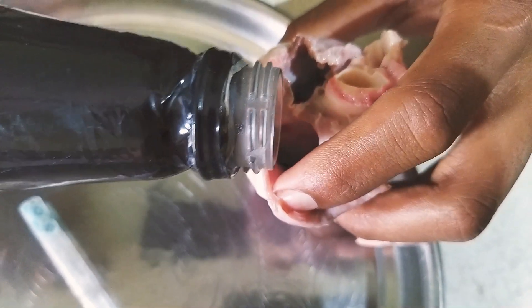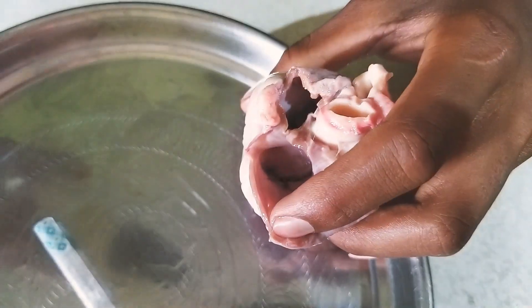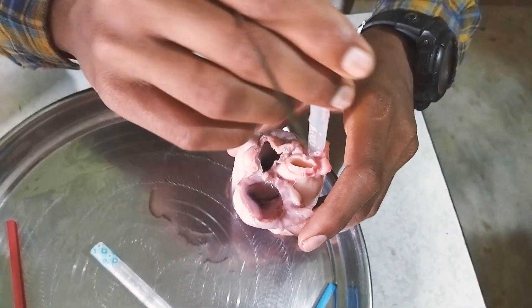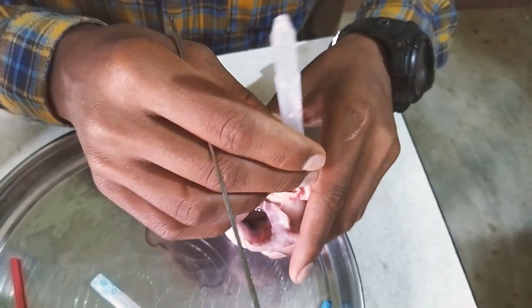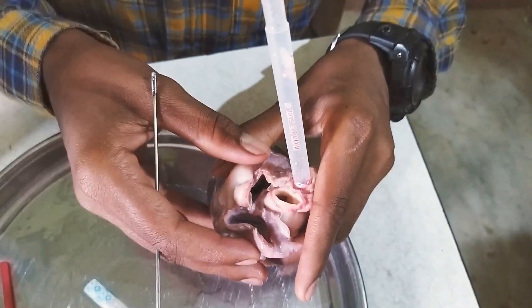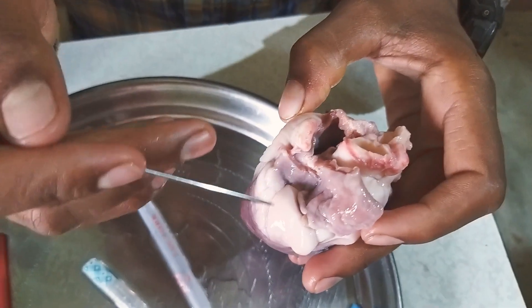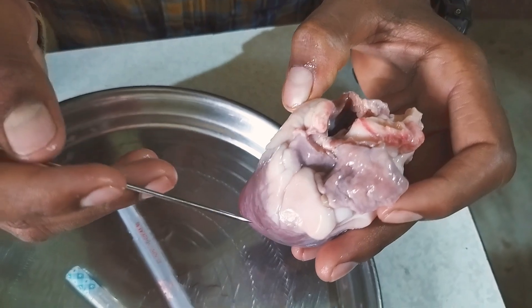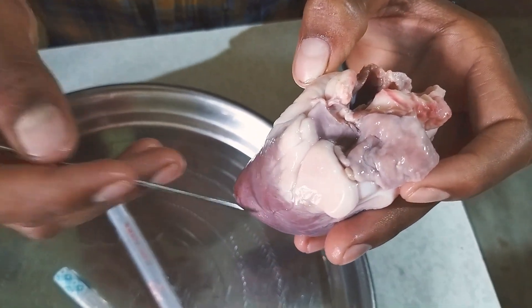I am filling some water in the pulmonary vein. Observe carefully, and keeping it in the aorta. I am closing this, and the water will come from the aorta. So the oxygenated blood from the pulmonary vein travels to the left ventricle. From the left ventricle, it travels to the aorta.